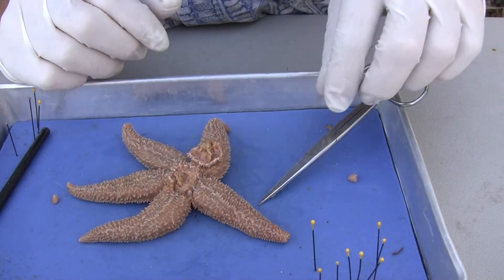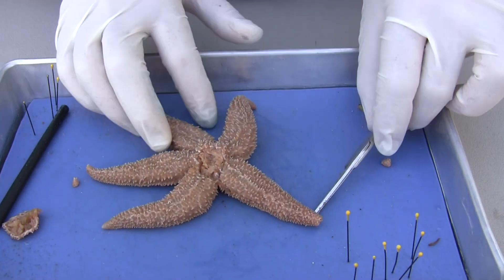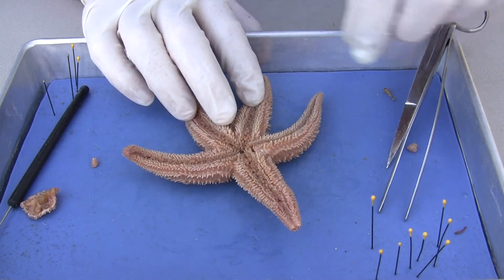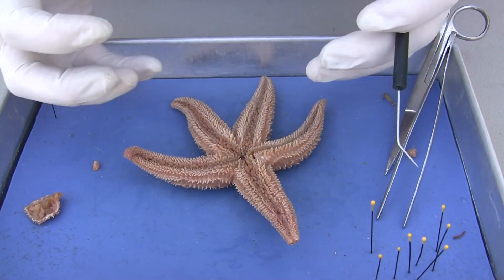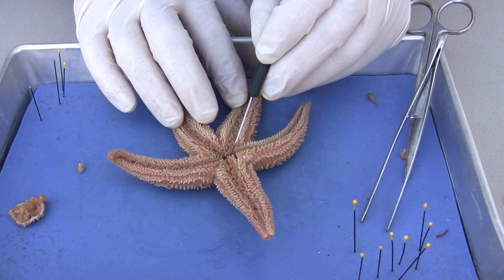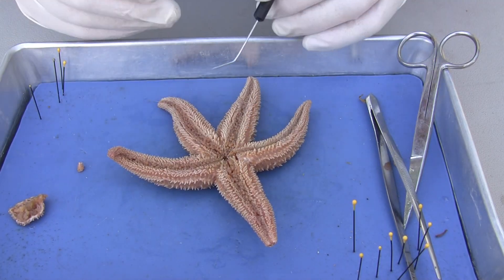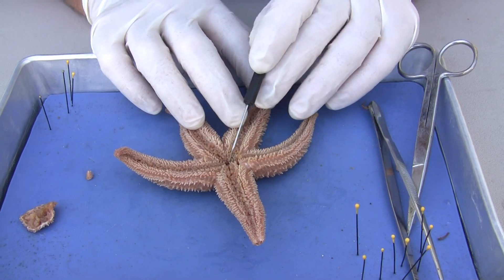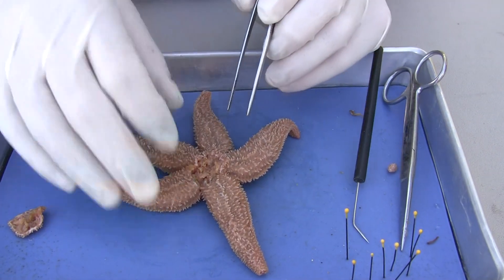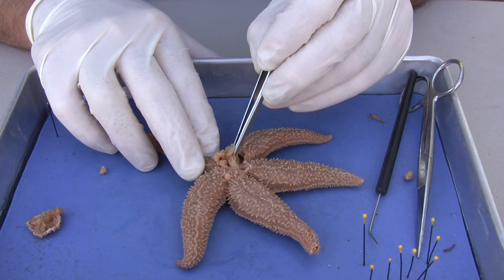So I just removed the top of the spiny skin, and a little bit of the stomach has come off with it. I've got to remove all the stomach. The stomach is kind of like a parachute-like material because when the starfish actually eats, the stomach comes out of the mouth right here. So let's say it's opening a clam — it uses its tube feet to pull the clam apart. What it does is it flips its stomach inside out into the clam and releases digestive enzymes, liquefies the clam's internal structures, and then pulls it back in so it can absorb some of that food. So right in here is where that stomach would come out. I'm going to remove the stomach, being careful not to hit the stone canal because we want to see that for the water vascular system.